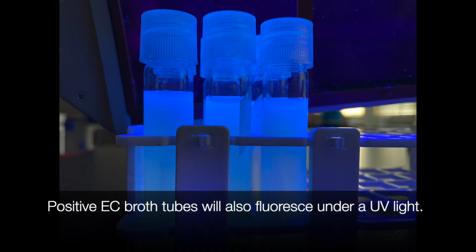Positive E. coli broth tubes will also fluoresce under a UV light. You can see the full results from this lab in your Blackboard folder. You should use these results to calculate your results for your lab notebook.